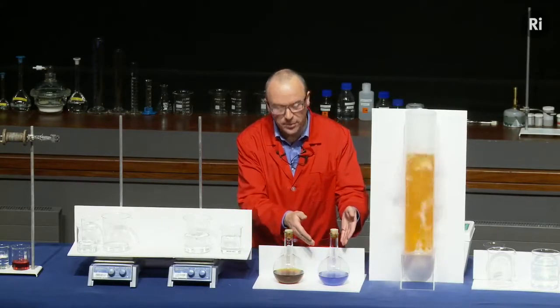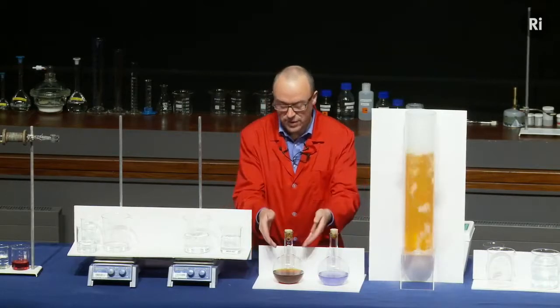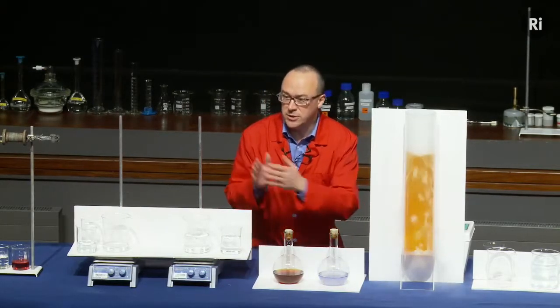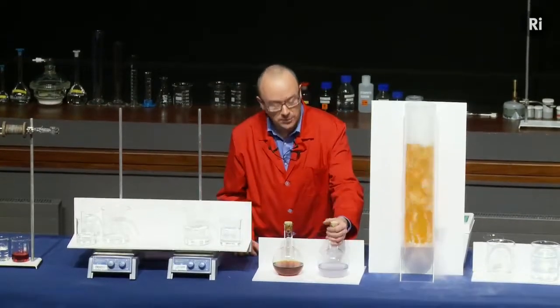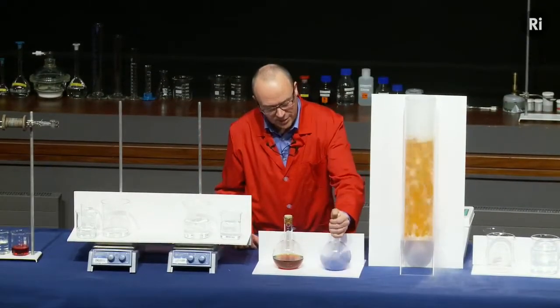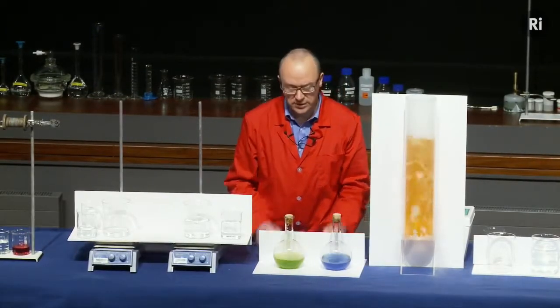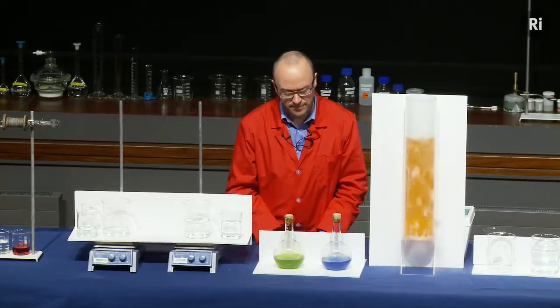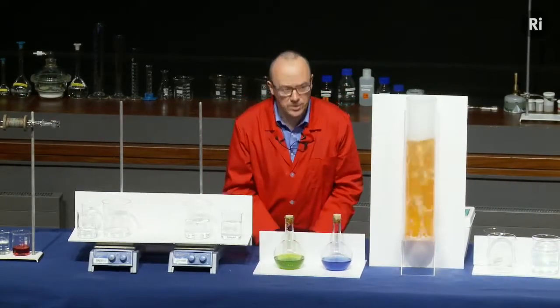And if we look here, the blue is turning back to being colourless. In fact, the red will go back to being yellow. So it's going back through that sequence of colours again. And what's more, I can even repeat it. So if I shake it again, it goes back to being blue. If I shake this again, it goes back to being red, and so on. And if I wait, it will go back. So again, it looks as if we have a chemical reaction that's going backwards.